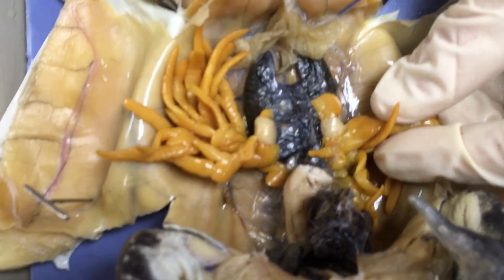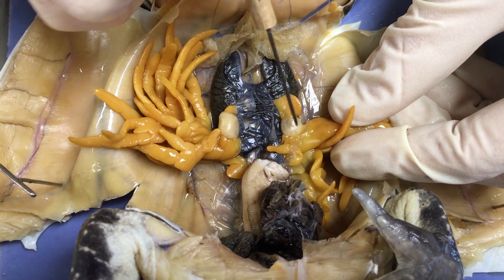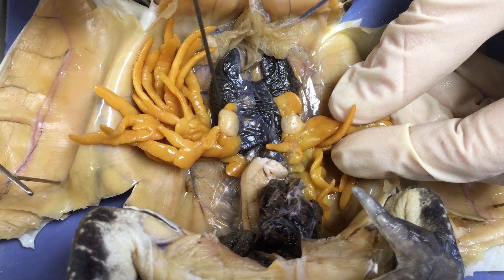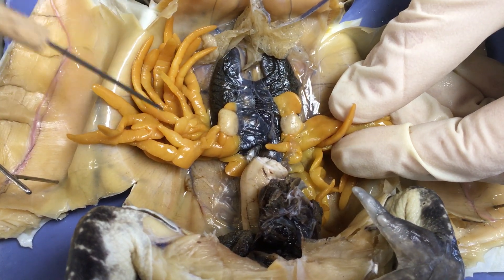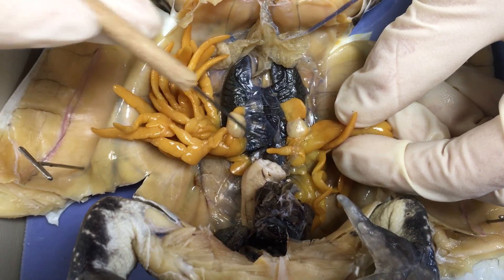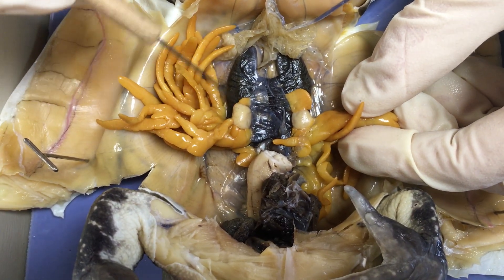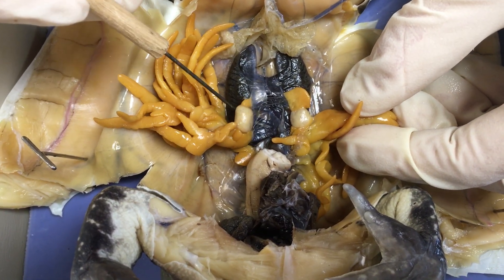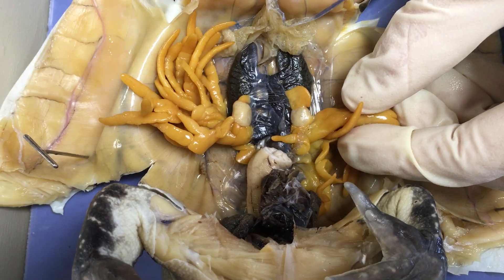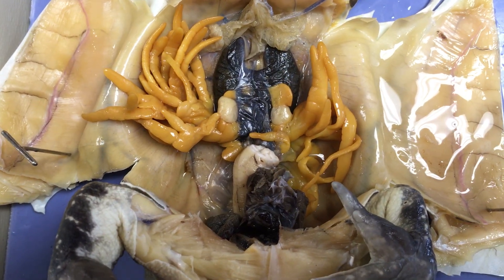This here is a male. These two structures right on top of the kidneys — they're paired — are the testes of the frog. They look kind of similar to the spleen: a different color, but about the same size and kidney bean shaped. So that tells you that this is a male frog.